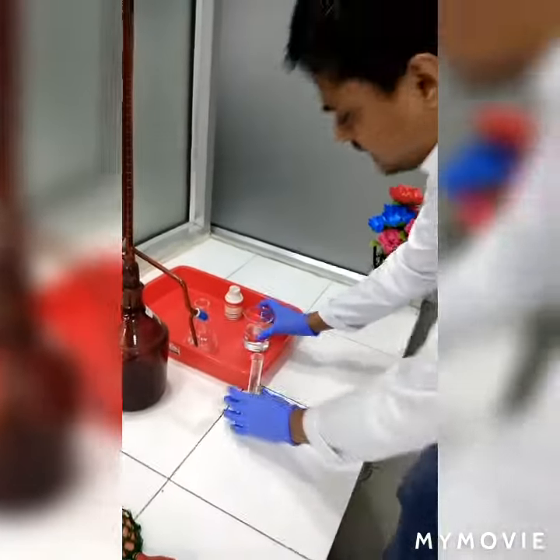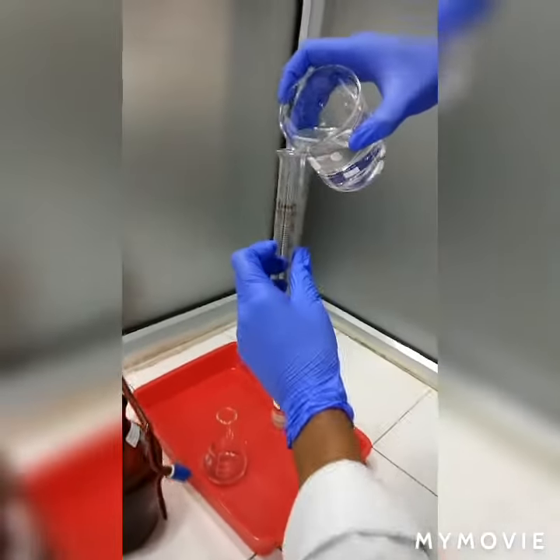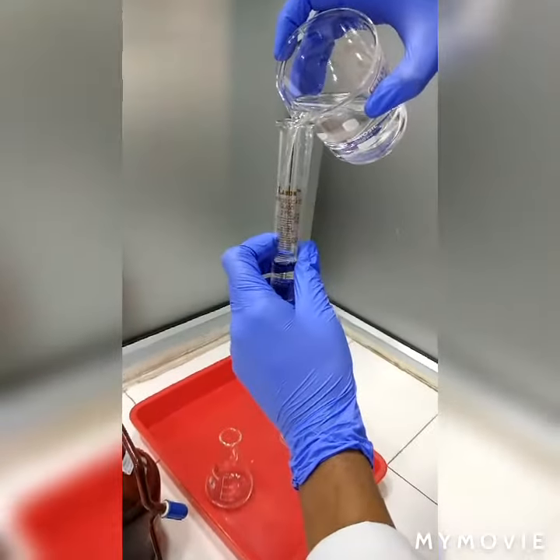This is a graduated cylinder. We have to take 25ml of sample.